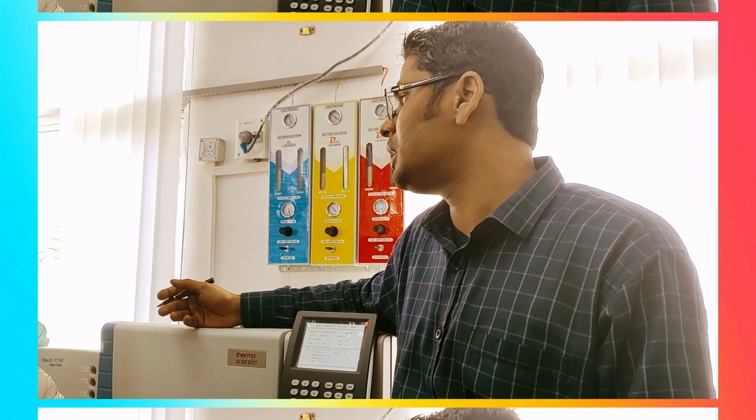The liquid oil is taken from the transformer. We check whether some acids are there or not, whether hydrogen is there or not. So much of that is from refinery gas, which is called RG, refinery gas.